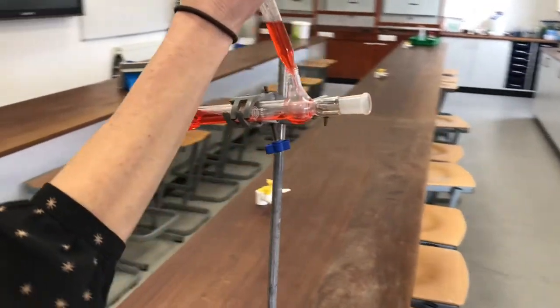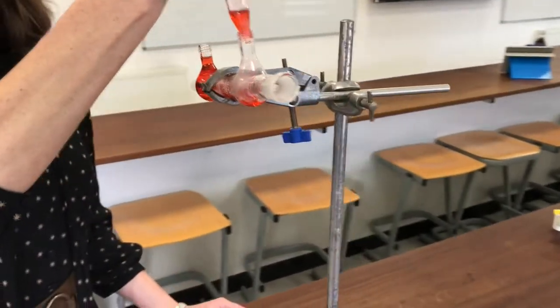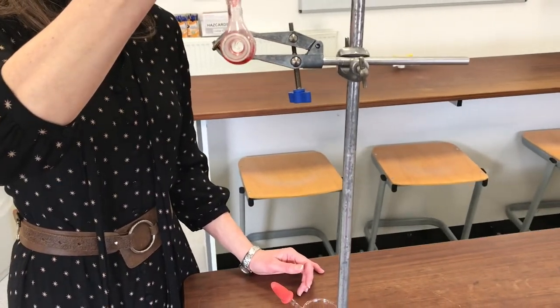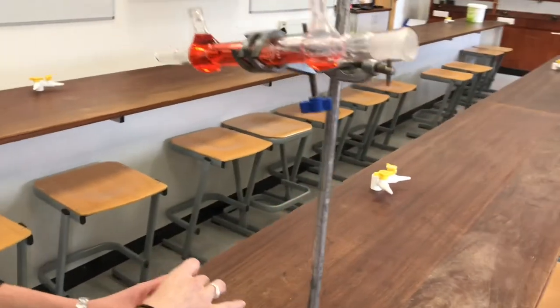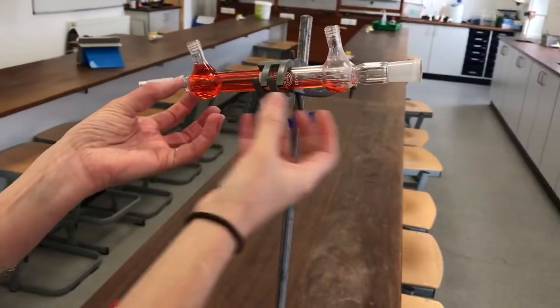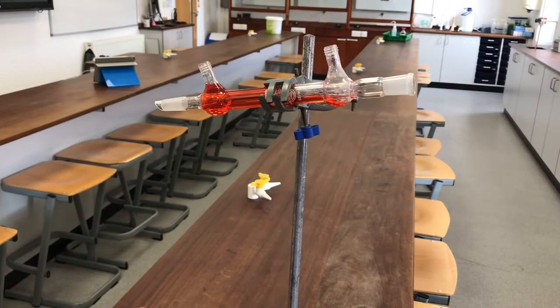Perhaps have a look around the end now while I'm squirting water into it. Okay, so you can see there's really definitely these two separate systems. There's a red water that's going around the outside and there's this empty tube down the middle.